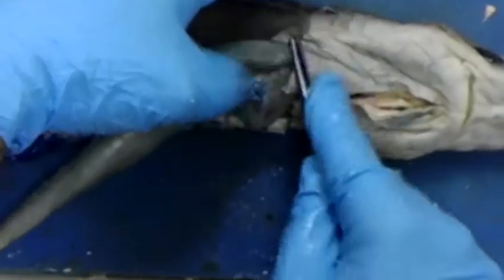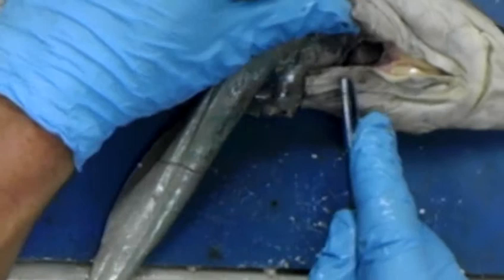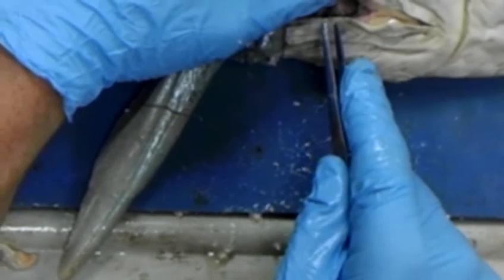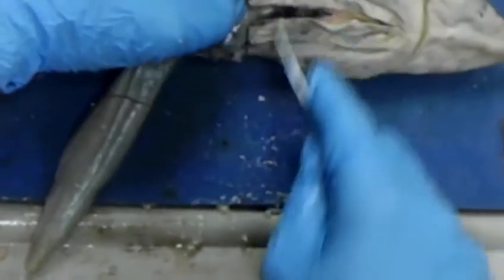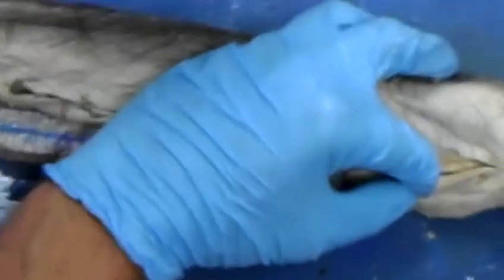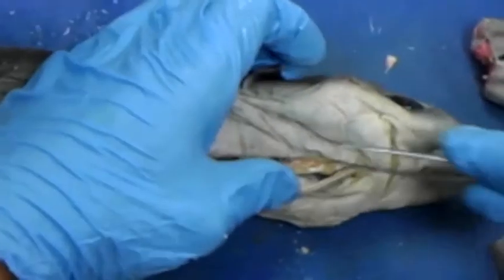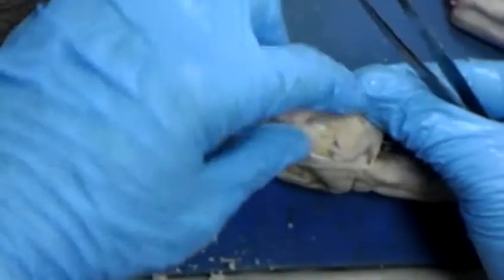Coracoid, because you've got a coracoid cartilage on what structure? I've said coracoid probably 50 times today. Coracoid process is on the scapula. Sharks have a coracoid. So this muscle is attached to the pectoral girdle, specifically the coracoid, and it inserts on the mandibula, or the lower jaw. That's the reason why I call it the coracoid mandibular. Notice the size of this muscle. This is just one side. That's a pretty thin muscle compared to this huge muscle mass here.